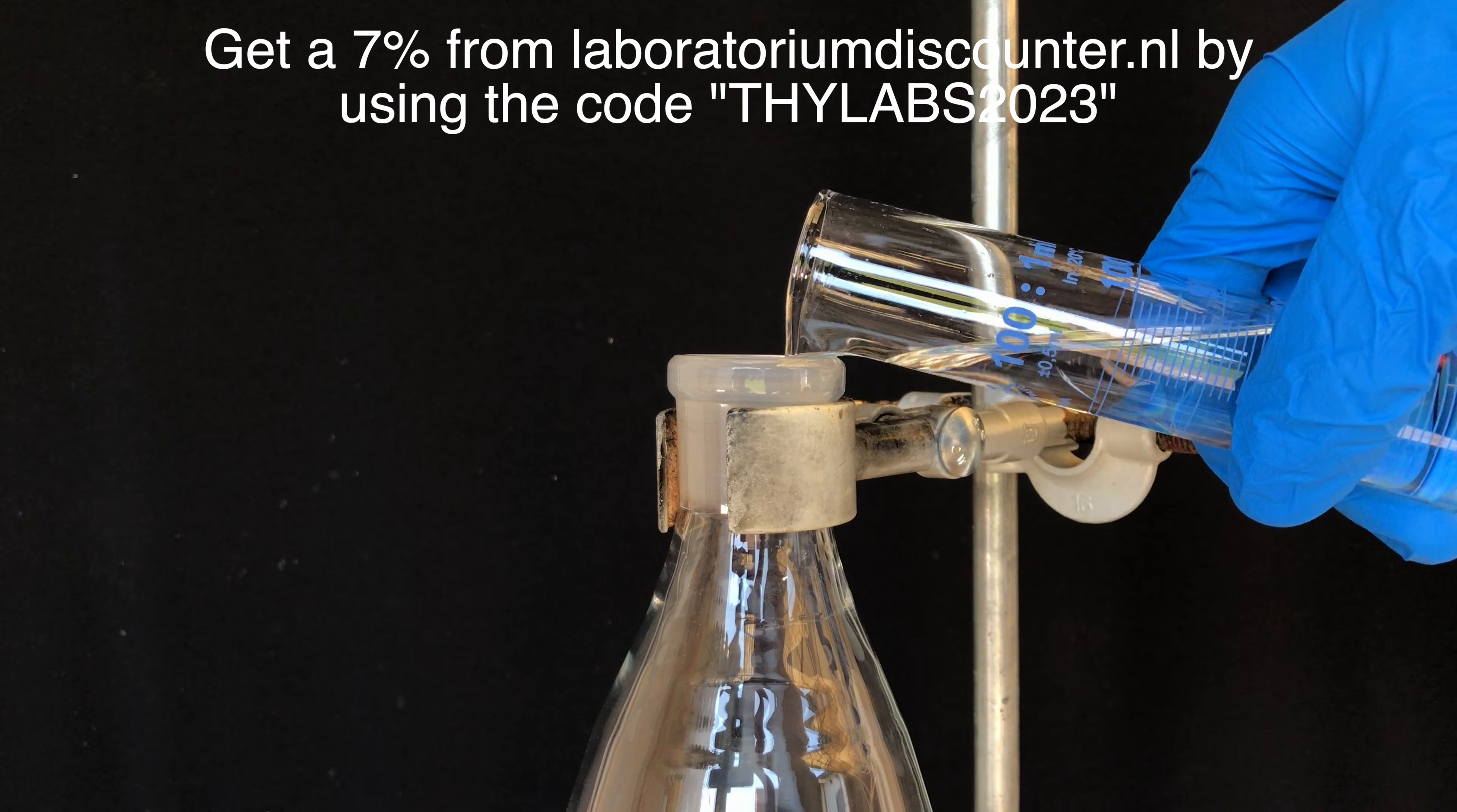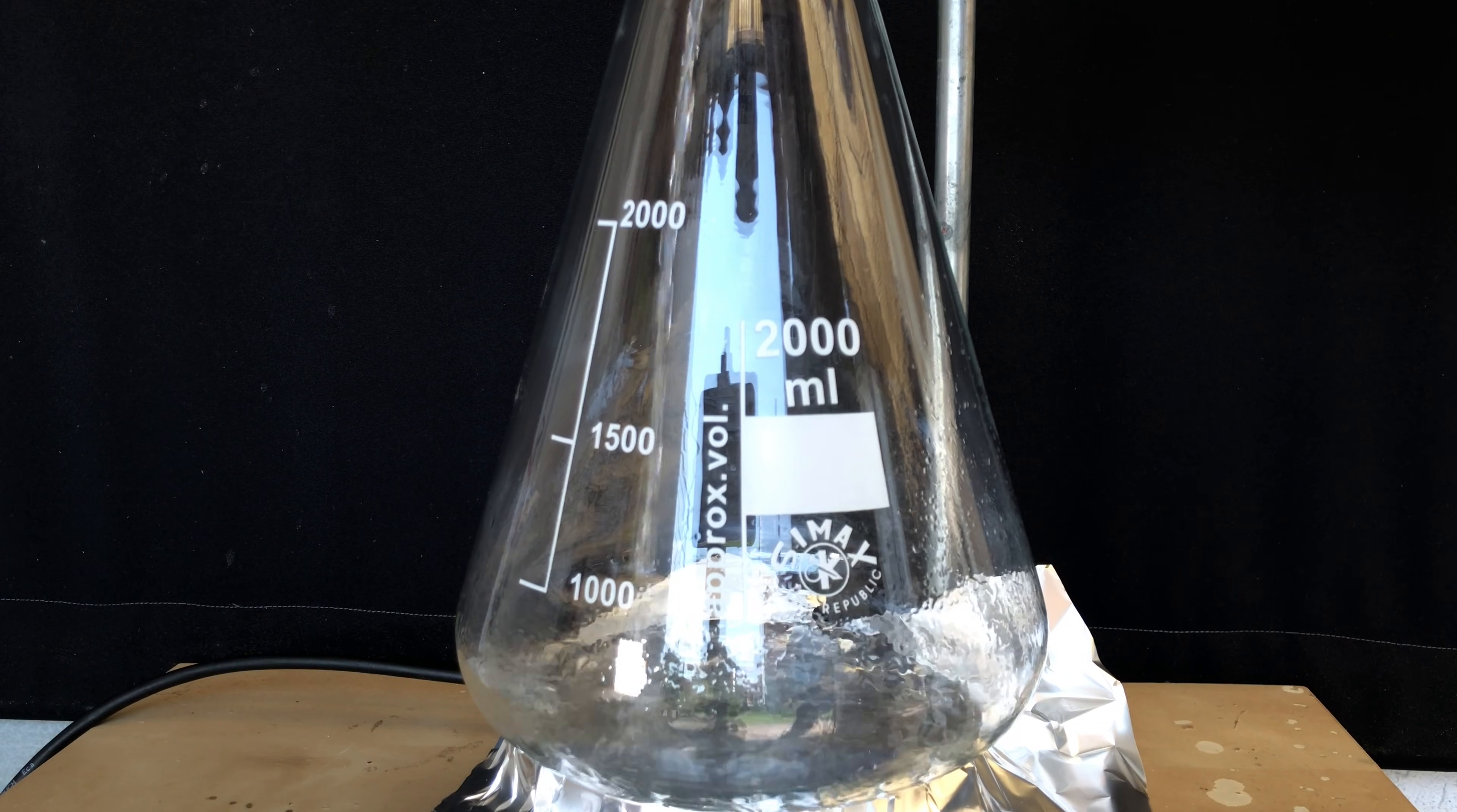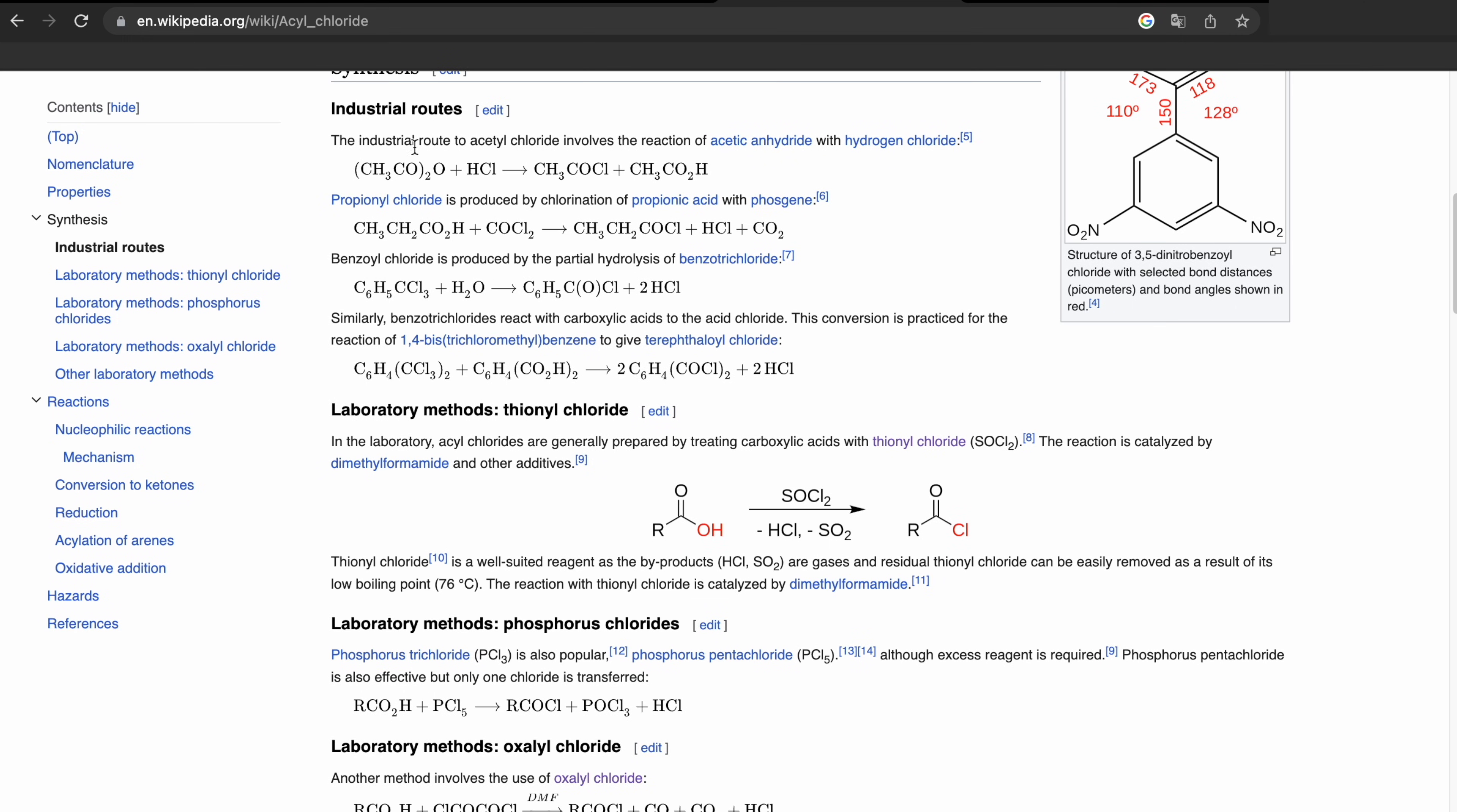I assume that most of you have never heard of this method of making acid chloride before and that's reasonable, I haven't heard of it before too. So let me explain what we are going to do.